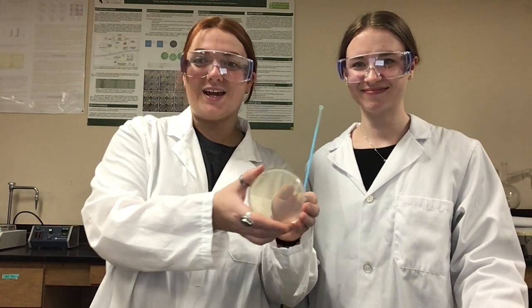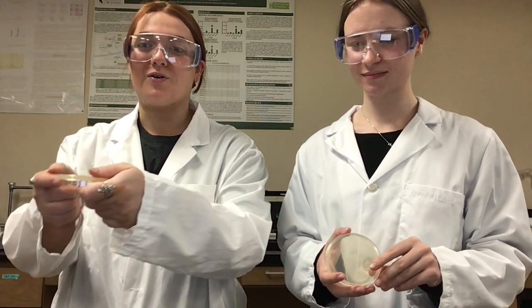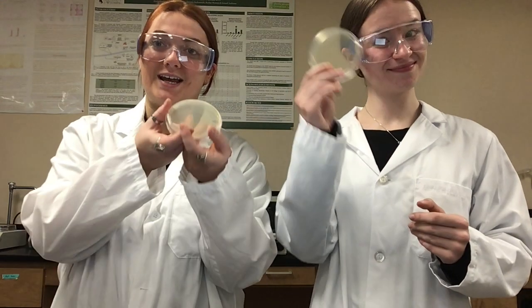So, if our inoculation loop is our paintbrush, then our agar plates will serve as our canvas. An agar plate is a petri dish that's filled with a nutrient gel. These are commonly used in microbiology labs to grow bacteria or fungi. And there's a variety of agar plates available for us to use in the microbiology lab, all of which have different available nutrients that can help or hinder the growth of certain organisms. Today we'll be featuring Mueller-Hinton and TSA.